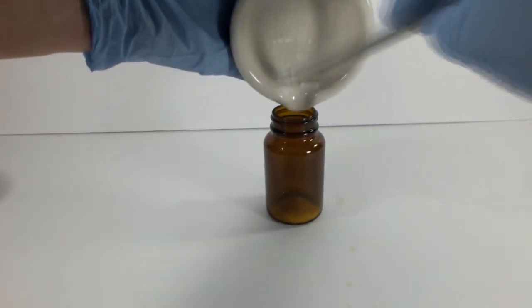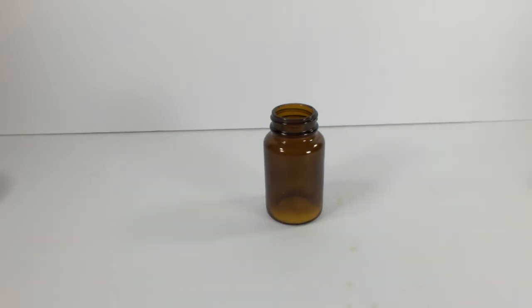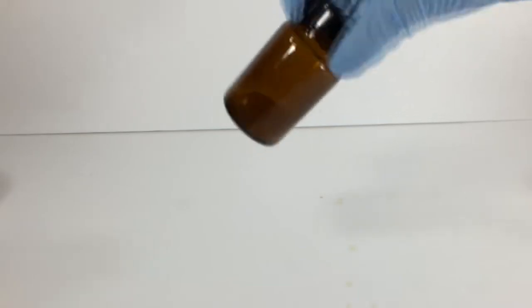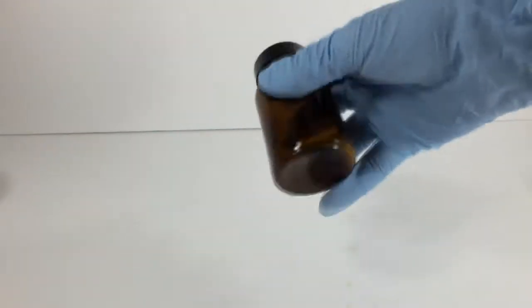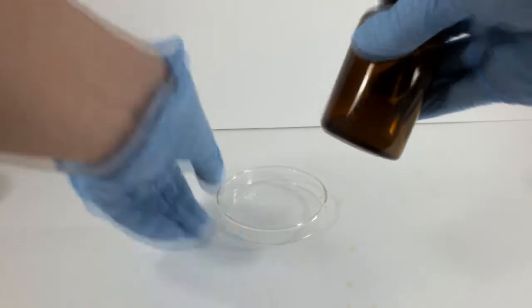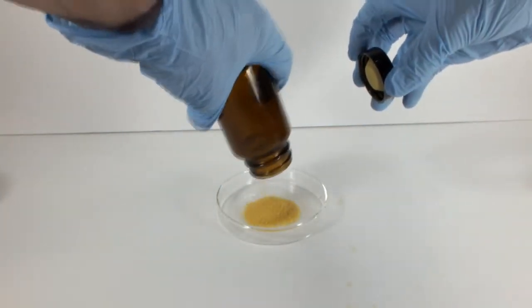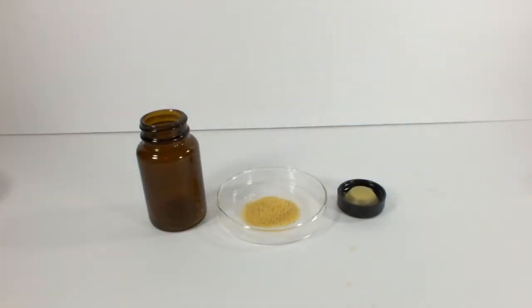Most reactions between inorganic compounds need to be in water or some other medium to get going. By vigorously shaking these two white solids together, for less than a minute I might add, there is a very pronounced color in the resulting mixture. It isn't as bright as lead iodide, but it's not pure lead iodide.